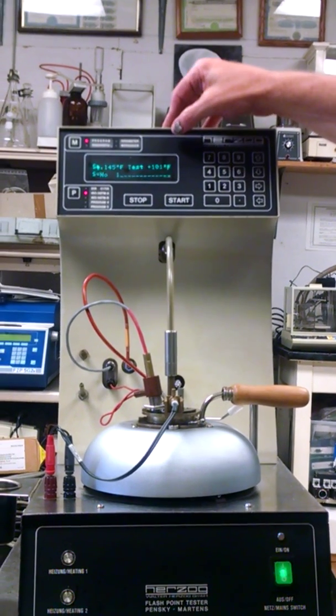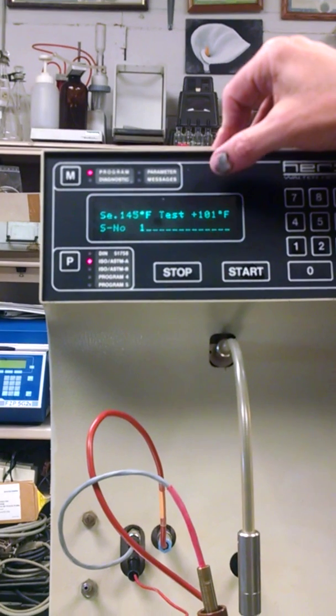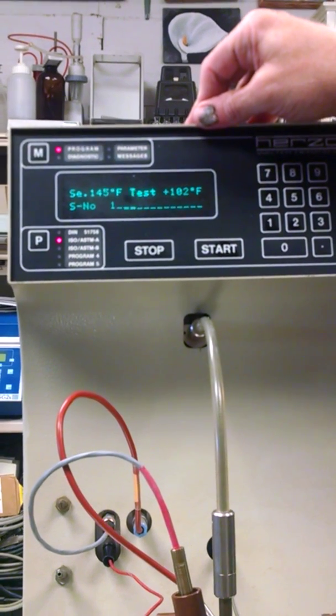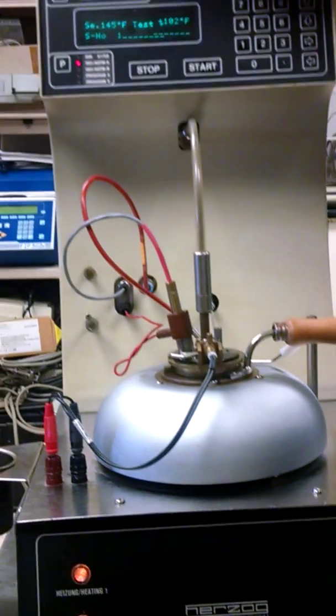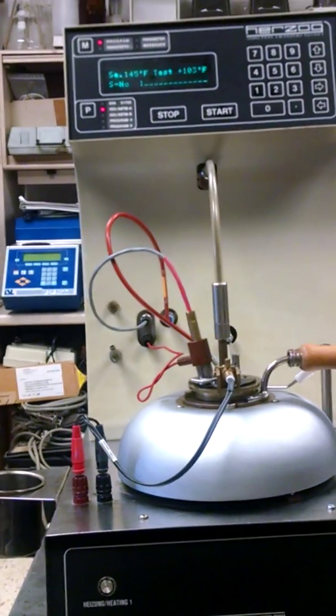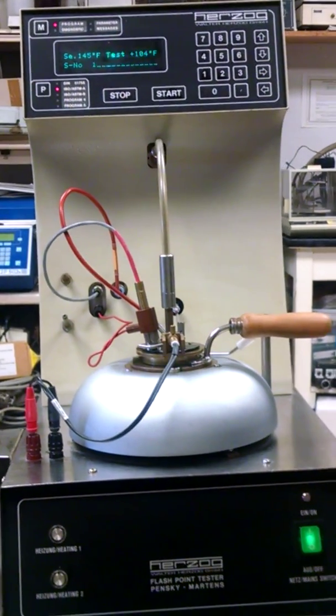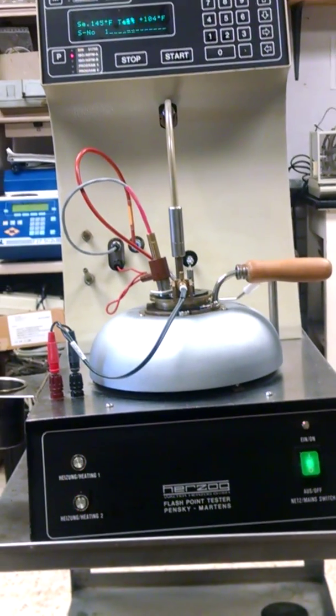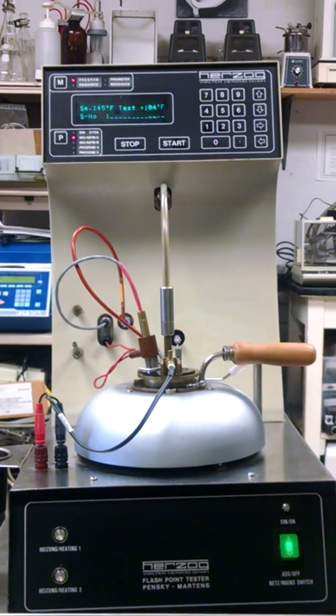Anyway, you can see it's starting to heat up pretty rapid now. It's at 101, 102. So it's starting to heat up pretty rapid. Here pretty quick it should start to dip down and try to flash. I think it'll probably 109. It might try to start flashing.